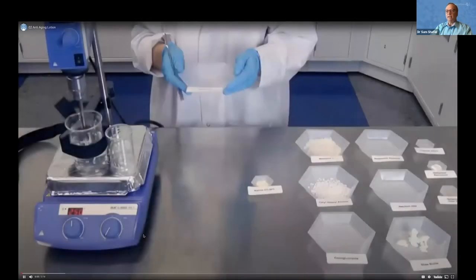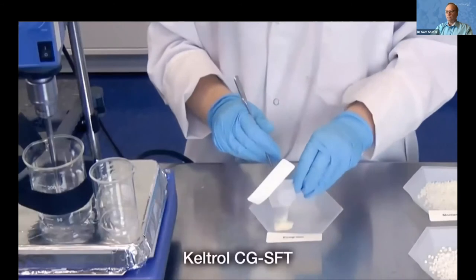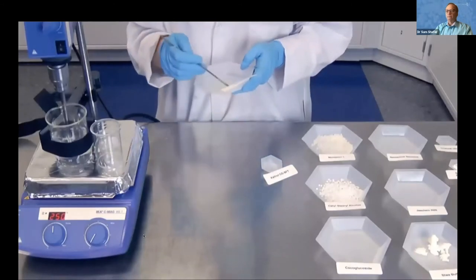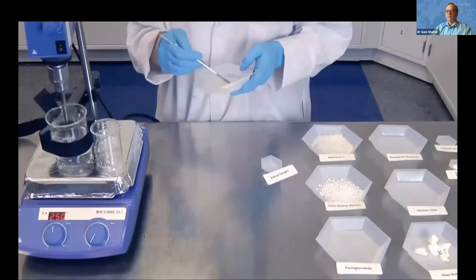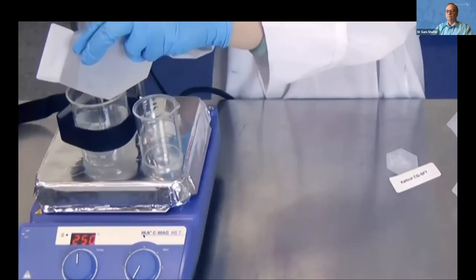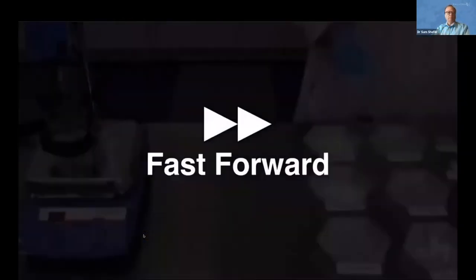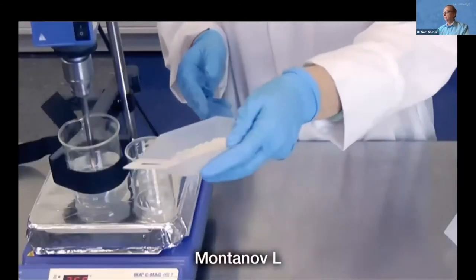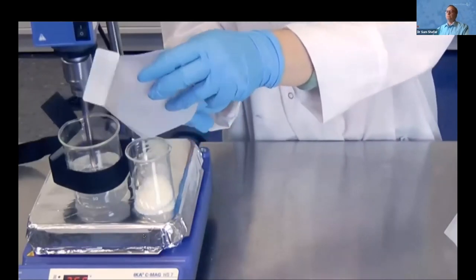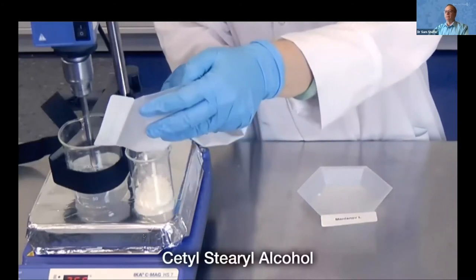First we pre-mix xanthan gum and glycerin to wet the polymer so that it becomes soluble in water. We are heating two vessels: the larger vessel on the left is the water phase and the one on the right is the oil phase. Once the dispersion is added, the water begins to thicken. For the oil phase, our first ingredient is Montanov L — C14 to 22 alcohol and C12 to 20 alkyl glucoside — which acts as an emulsifier. Next we add cetostearyl alcohol, which acts as an emollient in the oil phase.